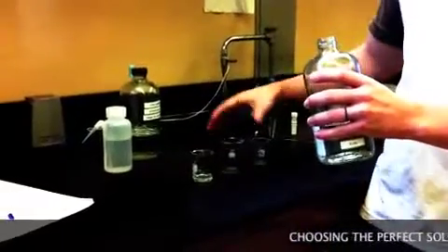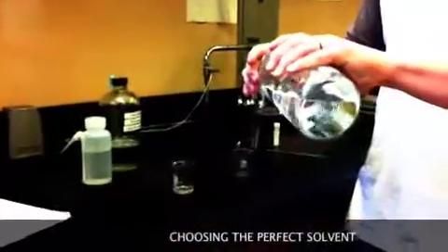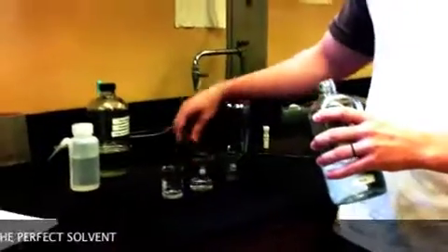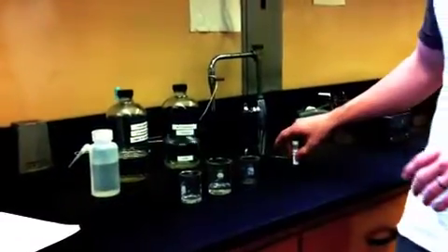So right now, I'm testing different solvents. Did you show the solvent? Yeah, to see which one is the best for the specific solid that we're trying to crystallize and purify.